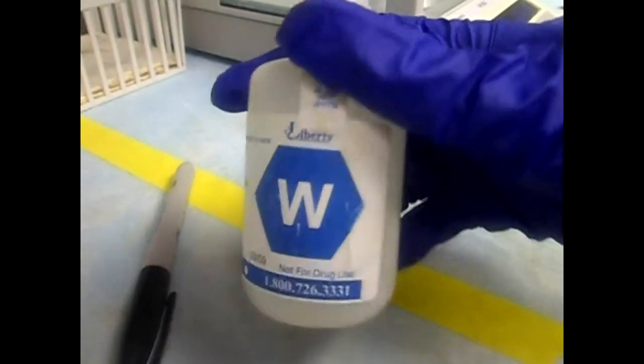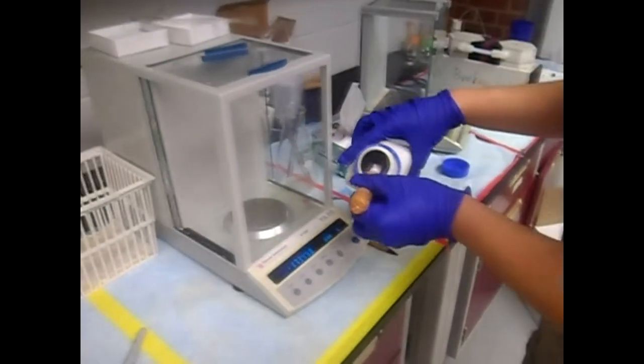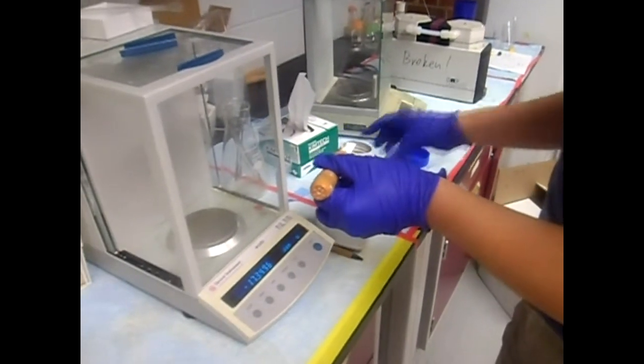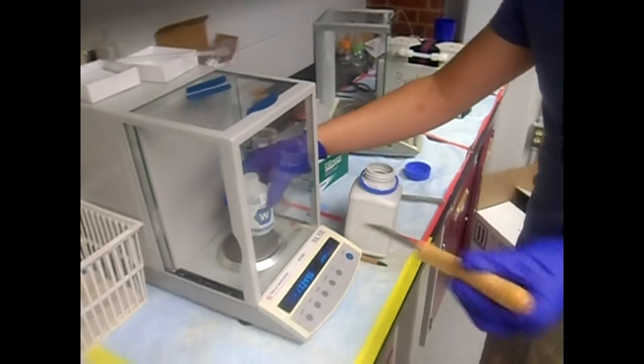Prepare all the amino acid solutions that pertain to the peptide being synthesized. Each amino acid has a specific marked bottle for the solution to be made up in. The specific weight needed will be dictated by the scale of the reaction and can be found out using the reagent calculator.